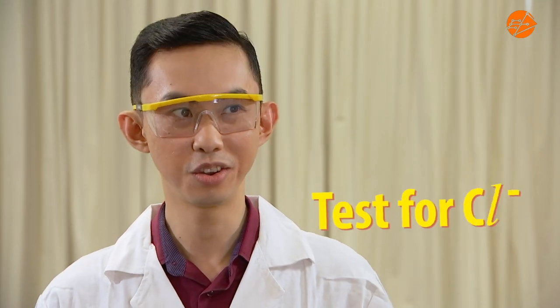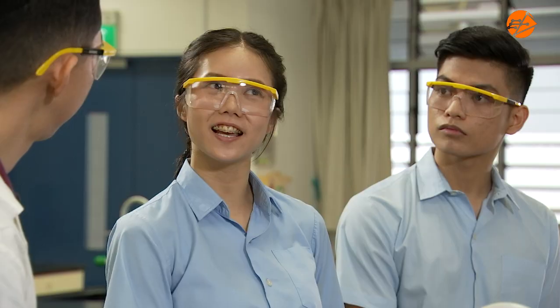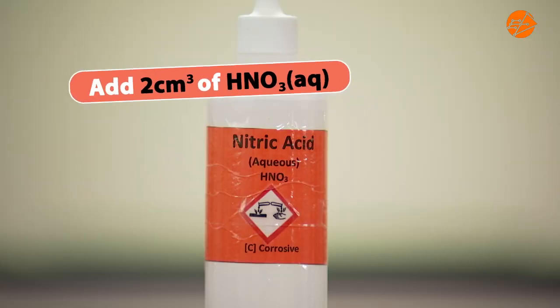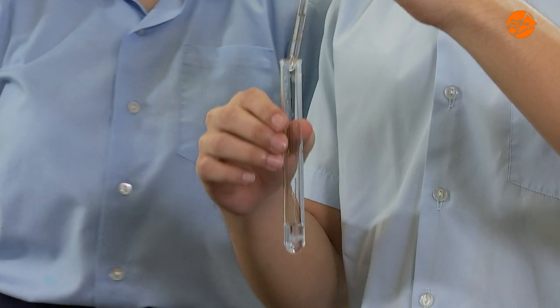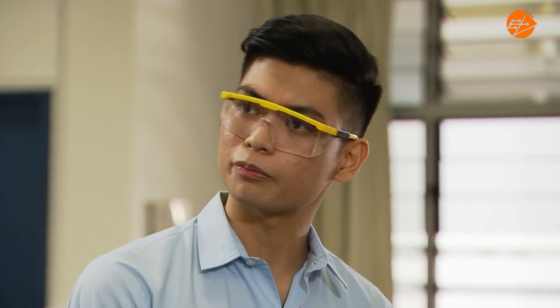For the calcium chloride solution, can I carry out the anion test for chloride? Of course you can. Do you know the test? Acidify the solution with nitric acid and add a few drops of silver nitrate. White precipitate forms. This confirms the presence of chloride ions.